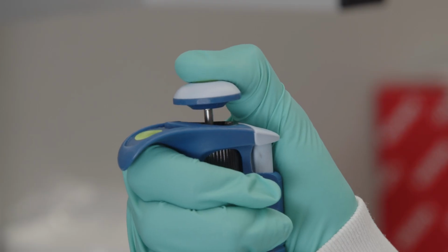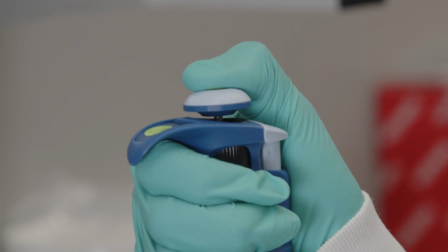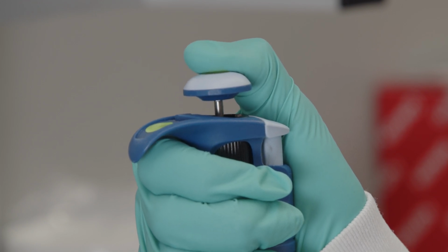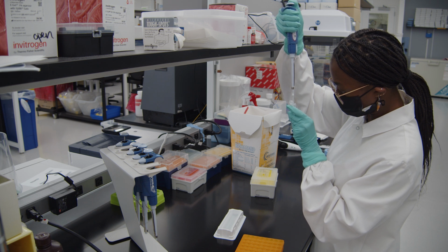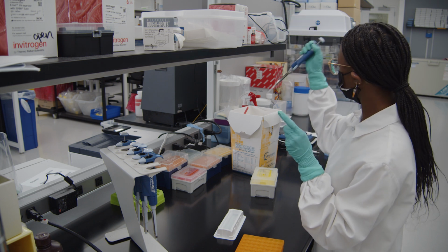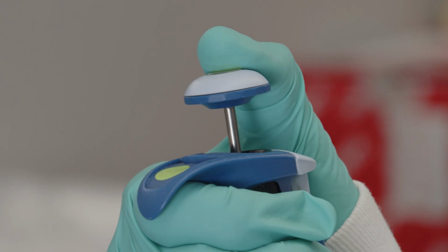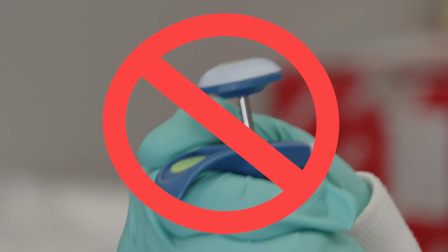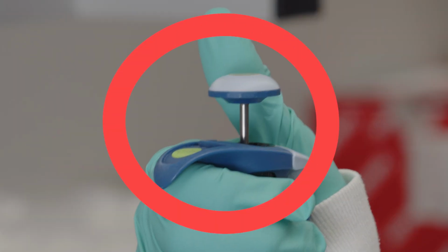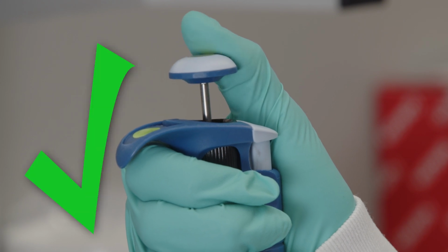And remember, you want a nice, slow, smooth, and steady release of the plunger. This will lower your error rate while pipetting, helping you to accurately dispense without introducing bubbles into your tube, well, or plate. Do not let the plunger pop up like a jack-in-the-box. Don't flick your thumb up or remove it too quickly from the plunger. Do keep practicing that steady plunger move.